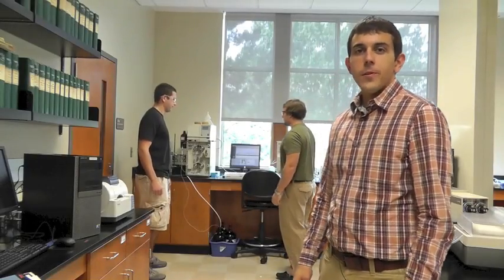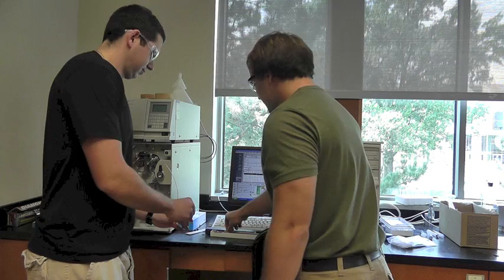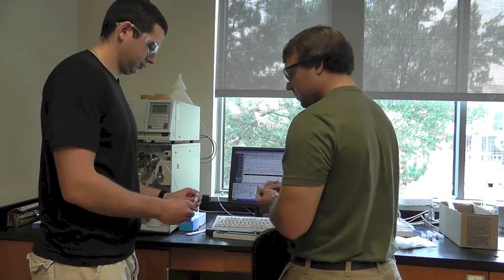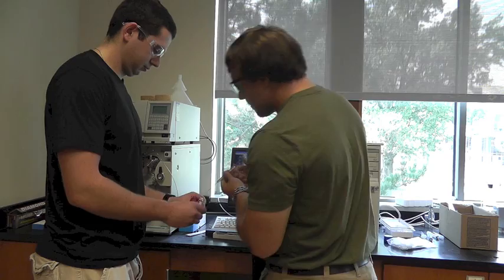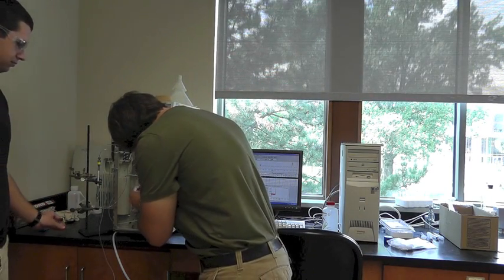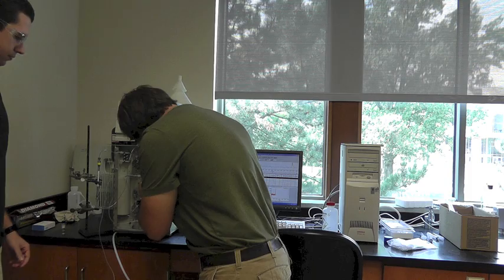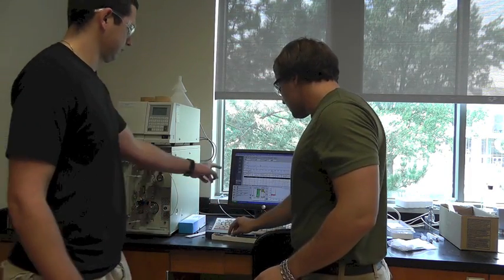Hi, I'm Dr. Woodward and Zach and Jimmy today are going to help demonstrate an instrument in the lab known as HPLC, which stands for High Performance Liquid Chromatography. Typically the experiment that they're working on is to analyze a solution containing both glucosamine and glucose, two carbohydrates. They'll take a liquid solution, inject a sample of that into the instrument, and the instrument will then provide a readout which gives us an idea of the relative abundance of these two materials.